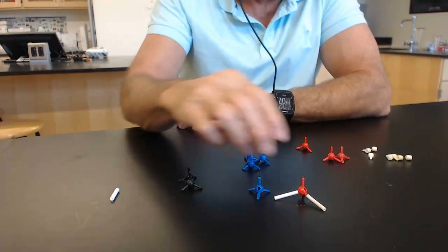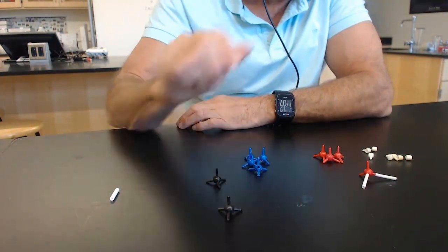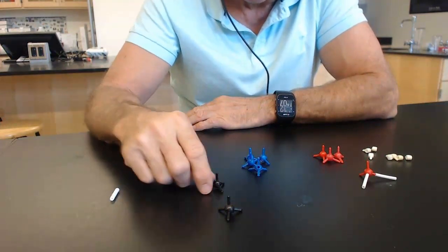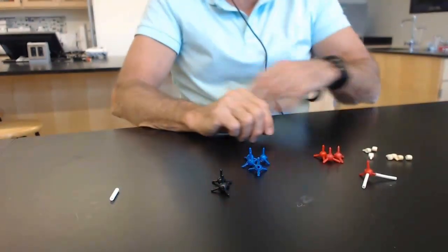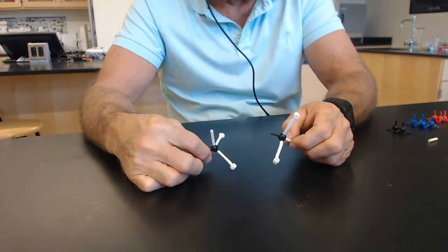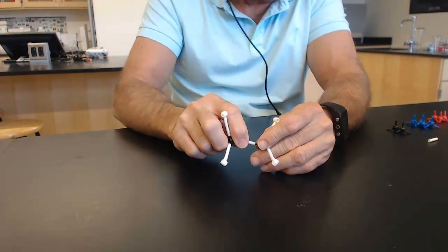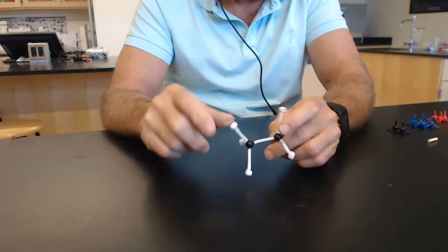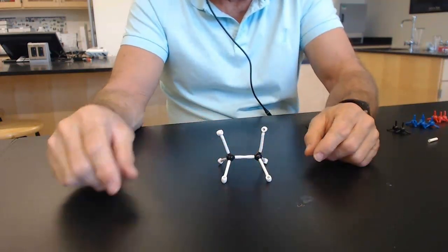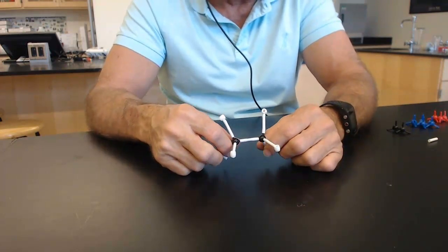And finally, carbon, which we have right here, forms four bonds and has no lone pairs and typically has the 109.5 degree bond angle and tetrahedral shape. It's pretty easy to stick these things together. I've made two fragments in the interest of time, and if you just take two carbon atoms and stick them together, well, you got a molecule. And I did put all the little hydrogen atoms here. And so if you see this, you should recognize this as C2H6. This is known as ethane.